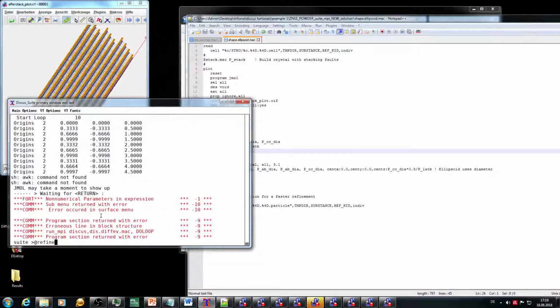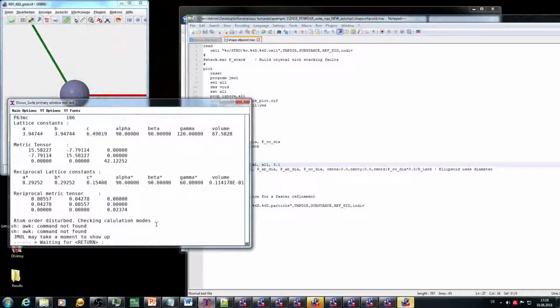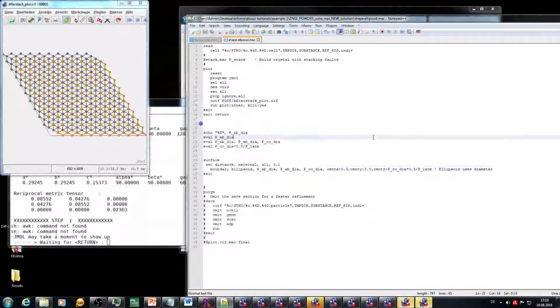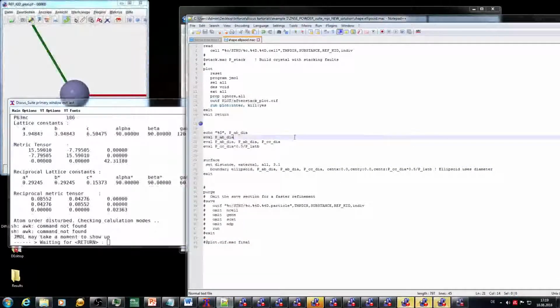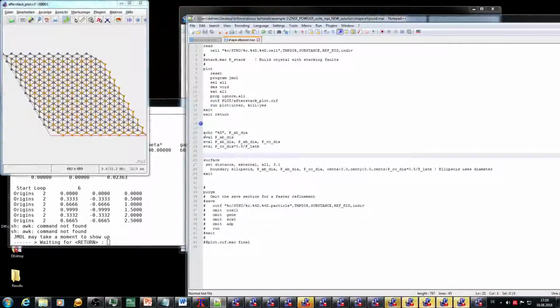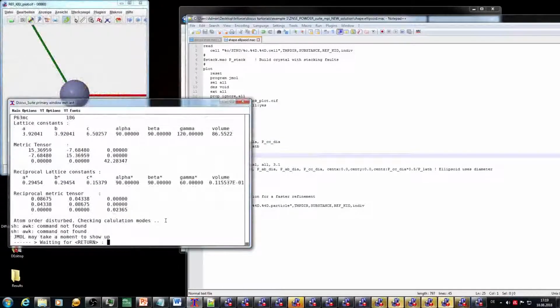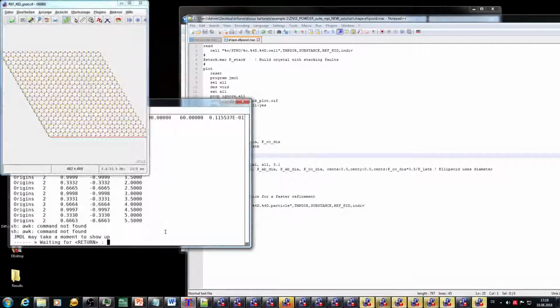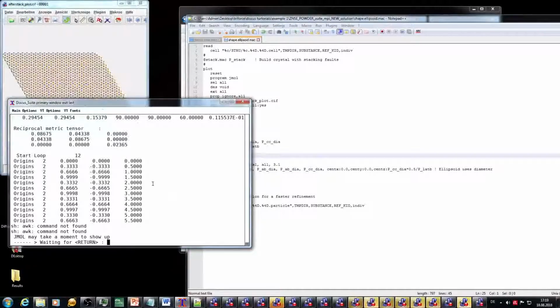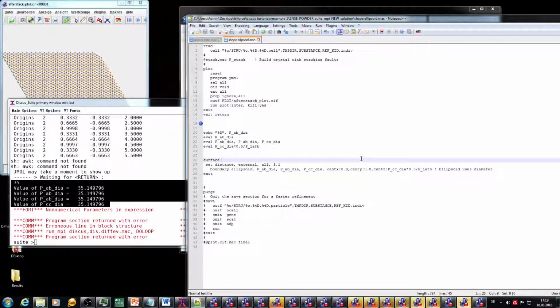When we now run the macro with these lines in there, and we just go up to the error again, so just before the surface command will be read, these commands should be printed to this window. So what we can see here in a moment, we are going through all the steps again, and we are seeing here the printout. Here at first, the first 35, the echo is pretty much this line.